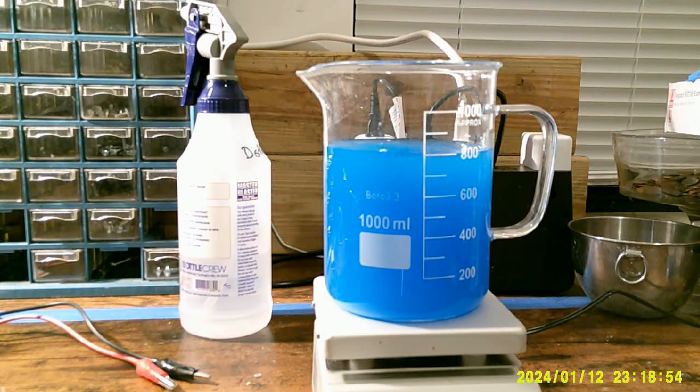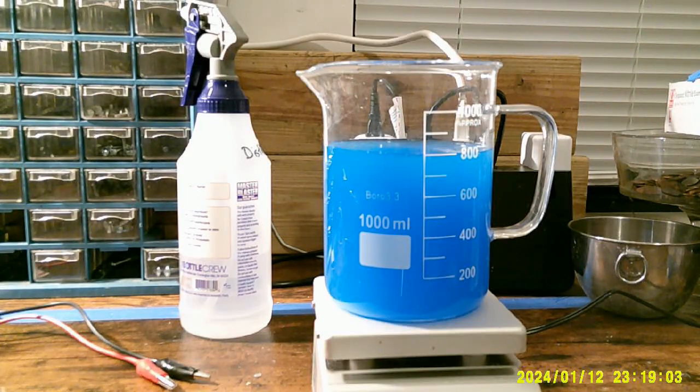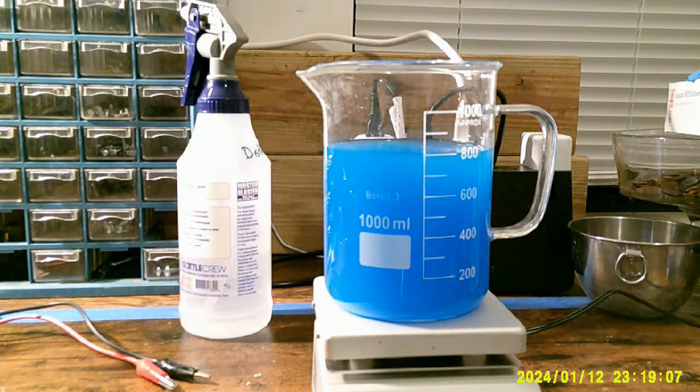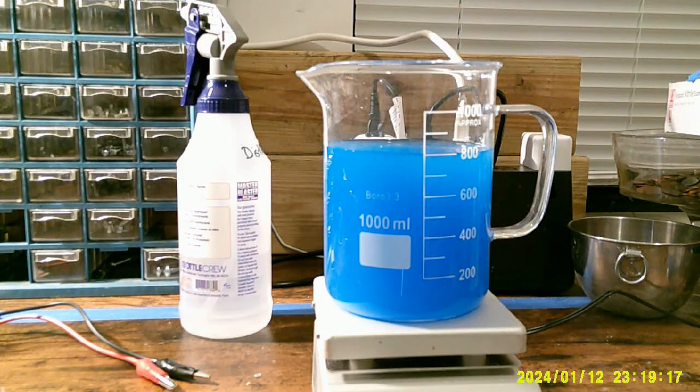It tends to take two to three months to grow a full cluster. You want to grow the crystal slowly as slow growth allows for more dense, larger crystals. And you want to run it at a very, very low amperage and voltage. I will show you when I set that up.